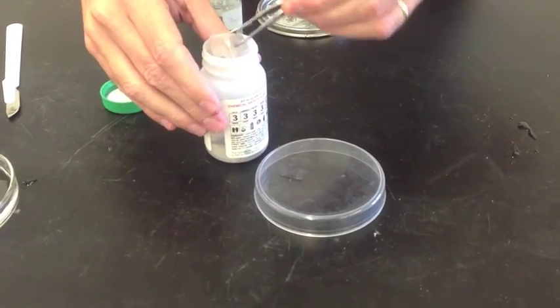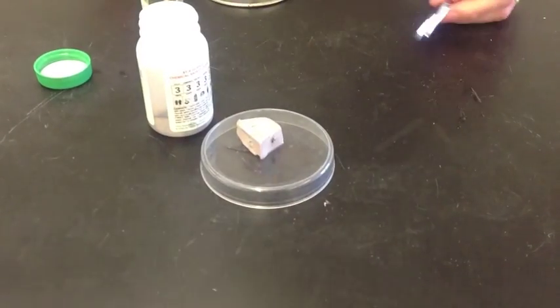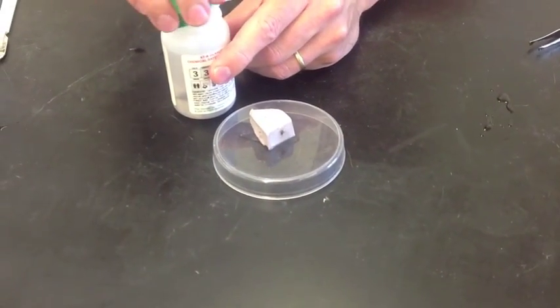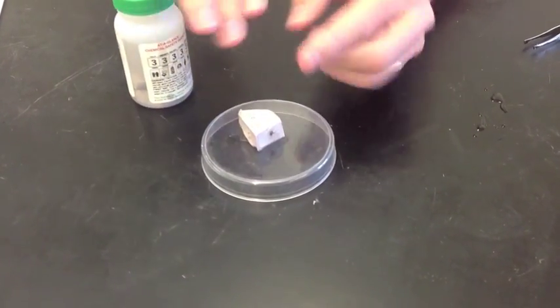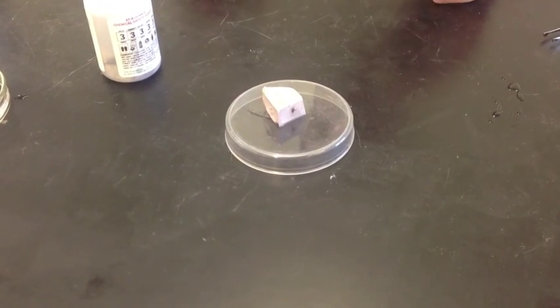The first thing you'll probably notice is that it does not really look like a metal. It looks just like a rock. The reason for that is the sodium is so reactive that the outside of it is very quick to react with open air.